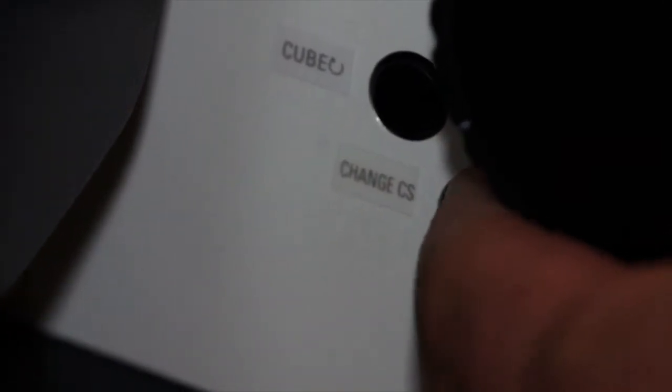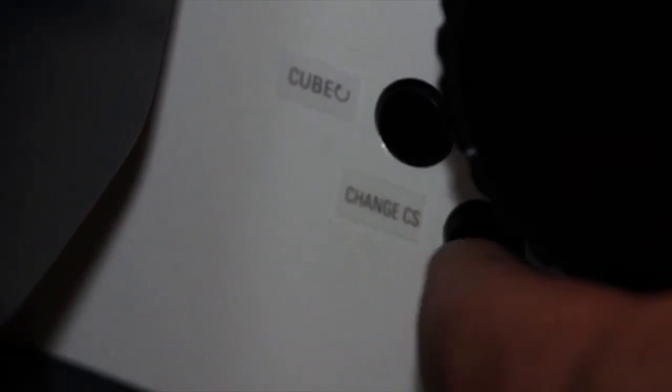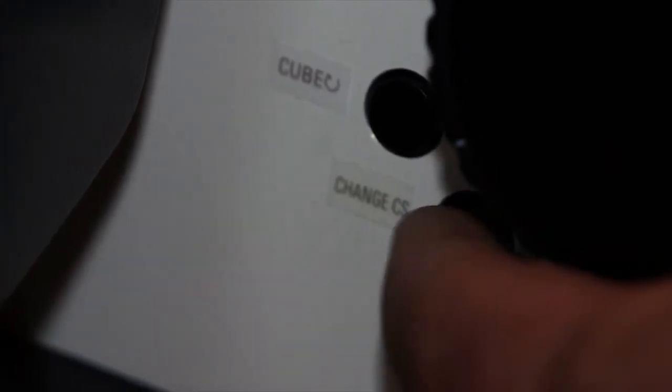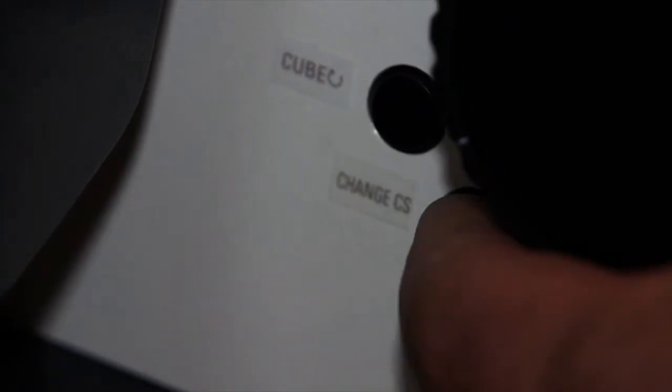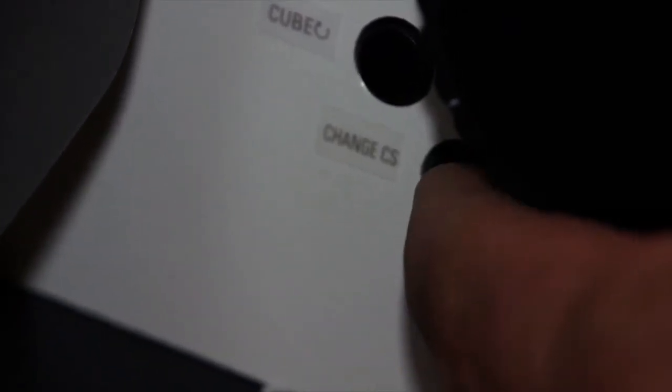For example, if you're going from FITC back to bright field or DIC, with one simple button you can toggle between those two. Finally, the bottom button is very important because it allows you to switch between observation through the microscope and sending the image over to the computer. When you push the bottom button, it sends the image to the computer for scan mode.